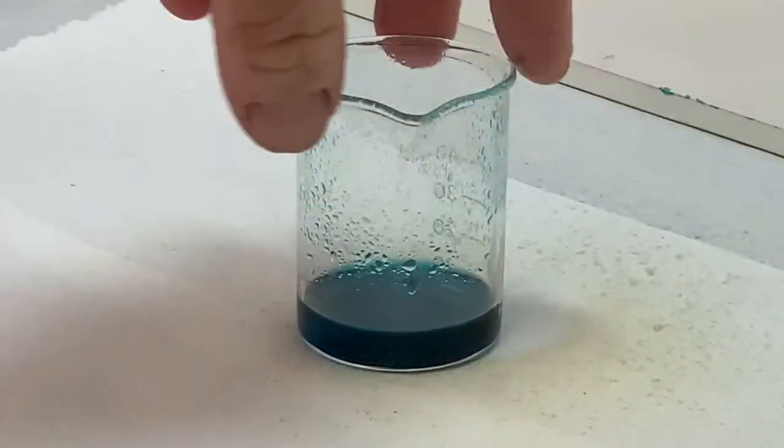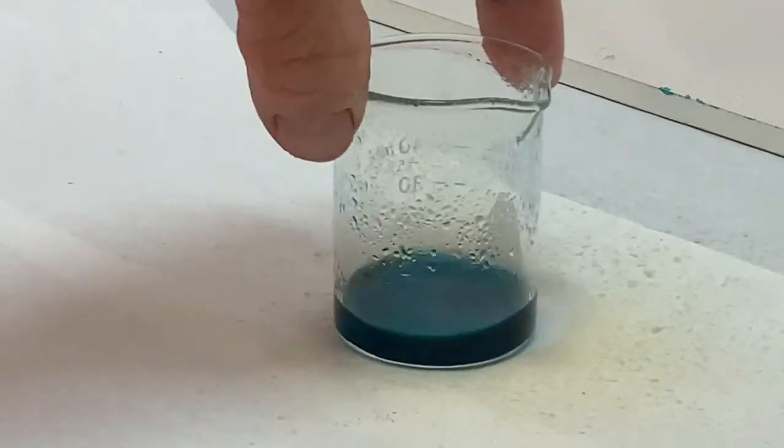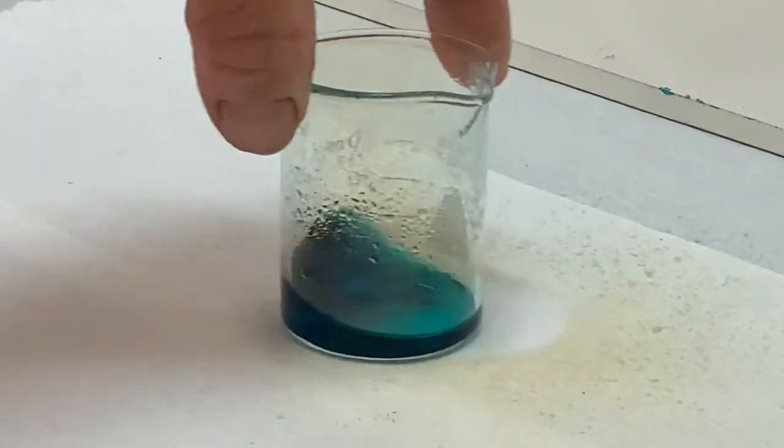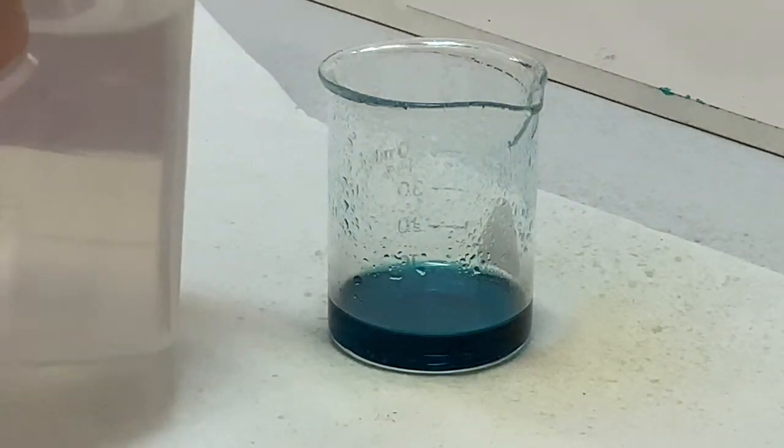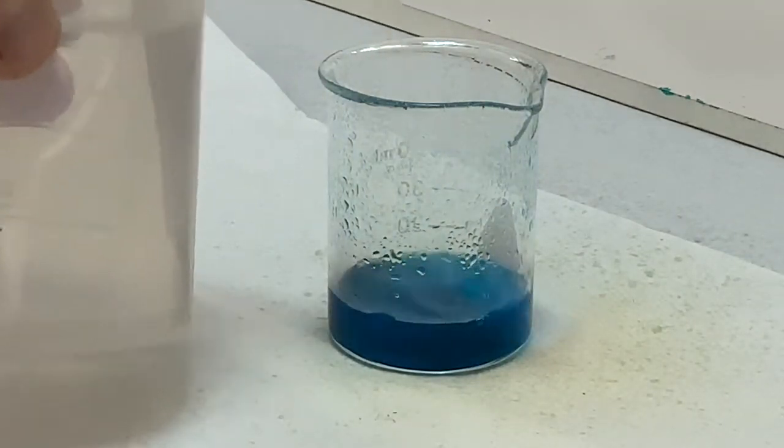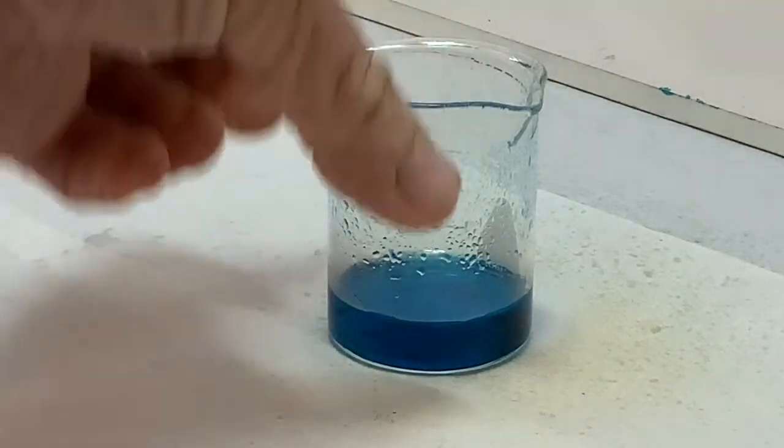With less and less gas emitted, it's important to swirl the solution. You can see that swirling the solution will cause a little bit more of the nitrogen dioxide to come out of the solution.